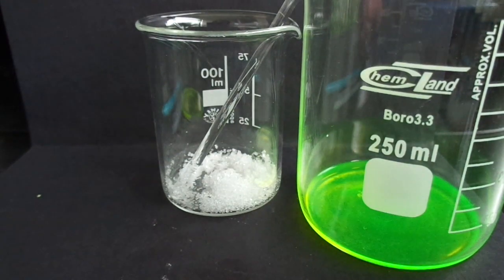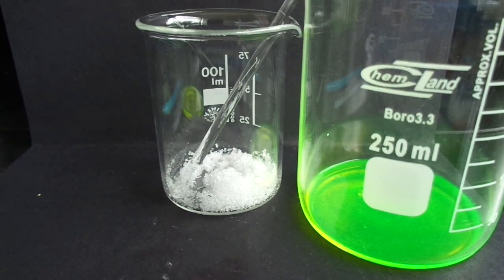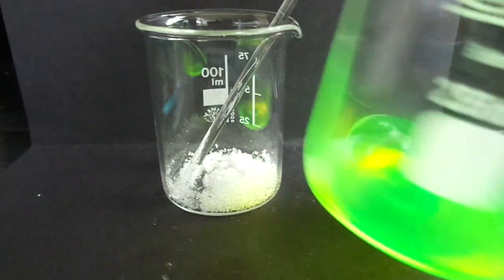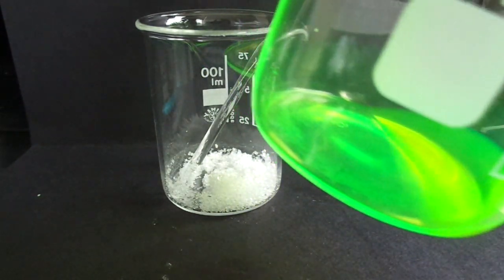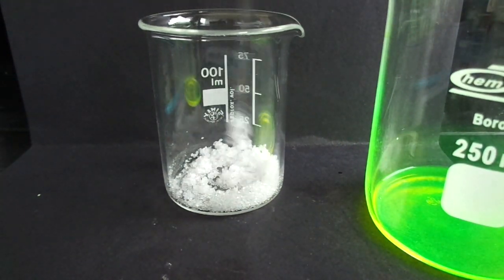In this video I'm going to show you how to make invisible ink that glows under UV light. For this you will need a solution of Pyranine — it's in basic solution as you can see, and it has this nice fluorescent color — and some citric acid.